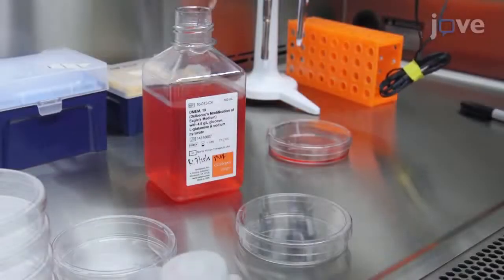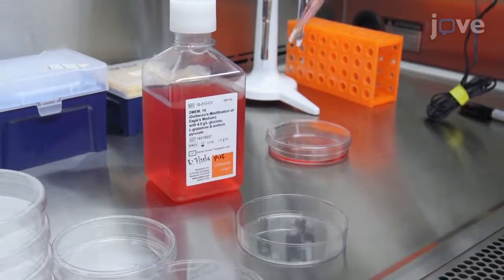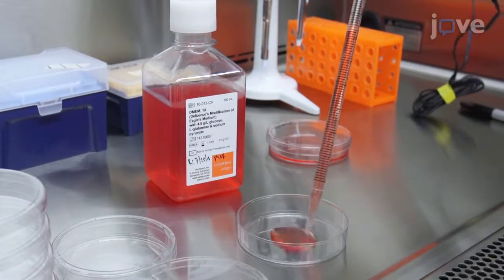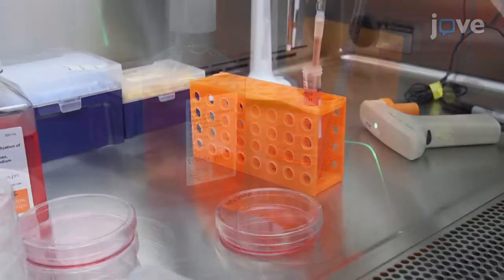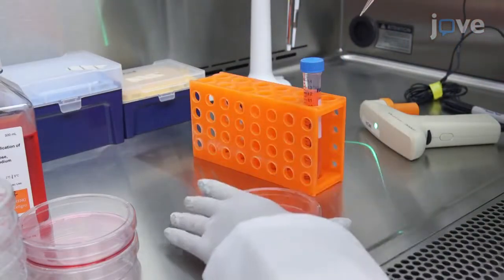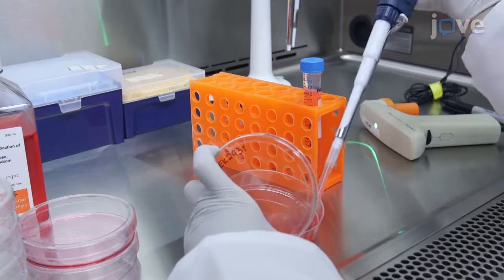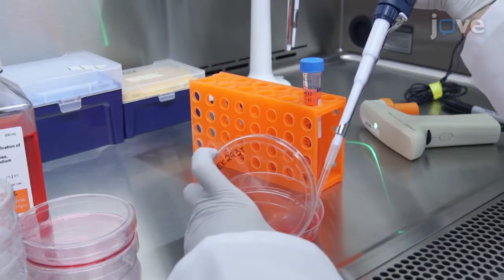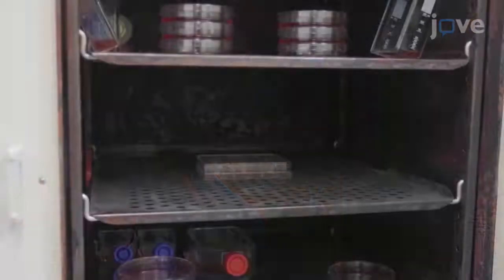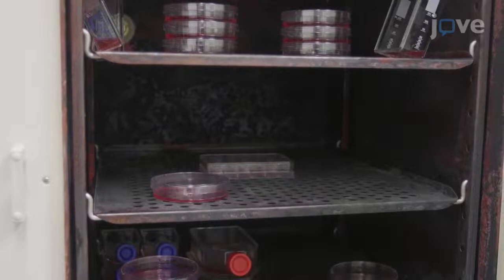For each plate, use 10 mL of DMEM supplemented with 10% FBS and 1% penicillin and streptomycin. The day before transfection, seed human embryonic kidney 293T cells into 12 10-centimeter plates using a hemocytometer to count the cells. Incubate at 37 degrees Celsius in 5% CO2.